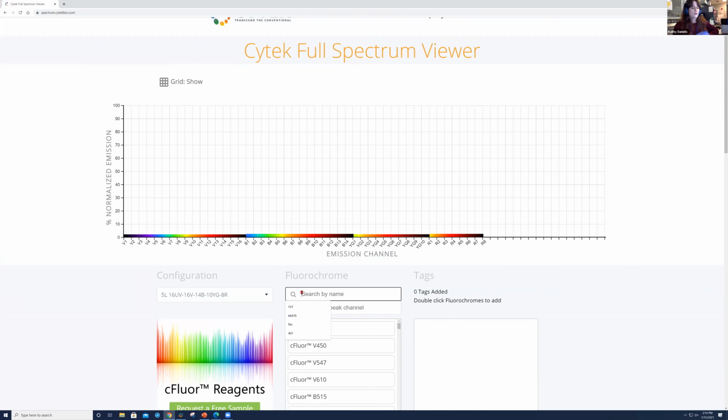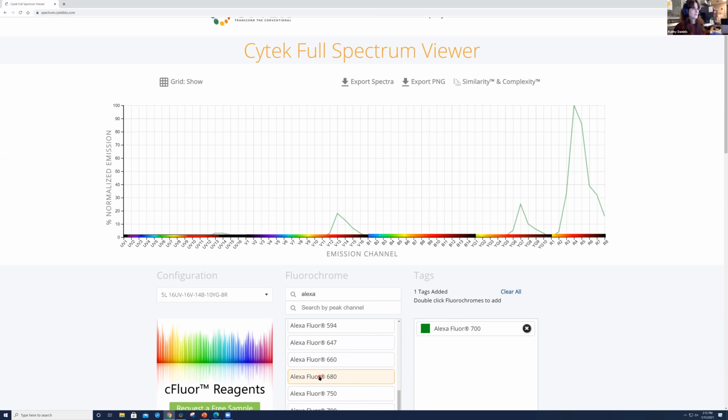Now, the two fluorochromes that we're going to look at for our next run that we recorded a little bit earlier is Alexa 700. So if I type in Alexa, can't type in that little R, so I'm going to scroll down. We see the Alexa 700. I'm going to double click on that. Okay. And the next one is APC R700.